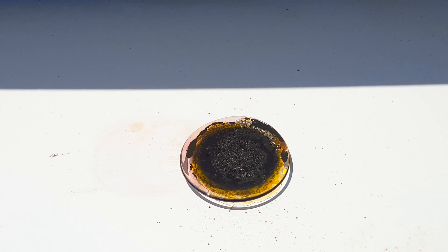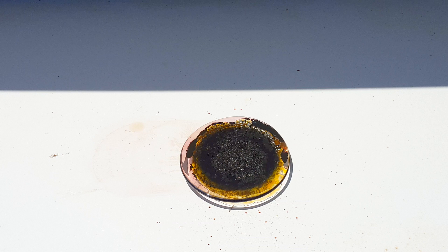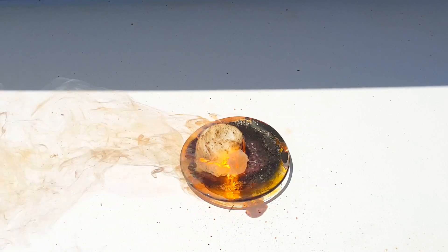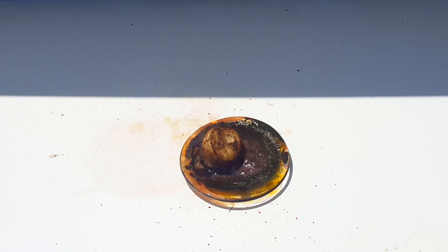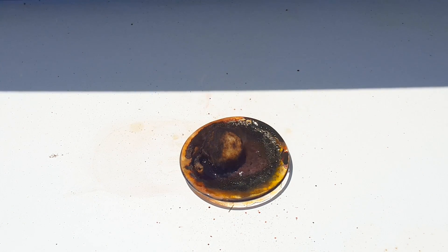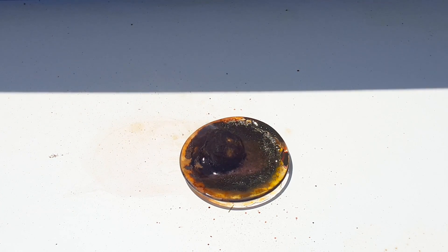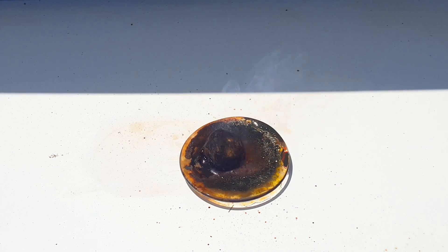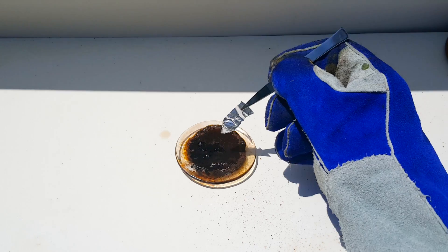Because this was so interesting, I wanted to try another cellulose product with a much higher surface area: cotton. Because the Manganese Heptoxide is better able to come in contact with the cellulose due to the cotton's increased surface area, this reaction takes off much more rapidly. The exothermic nature of the reaction allows the cotton to catch fire and burn in air.